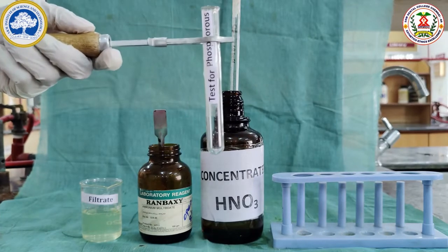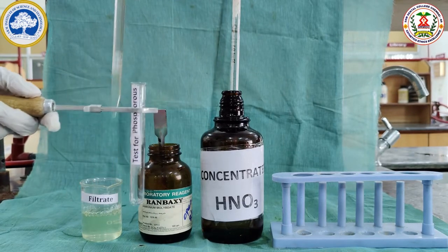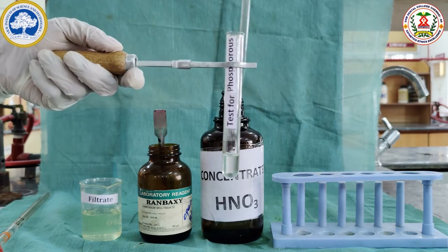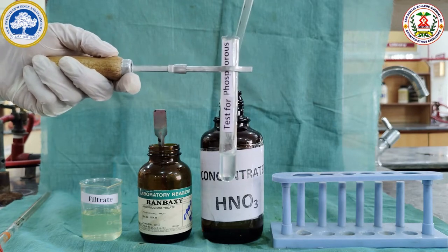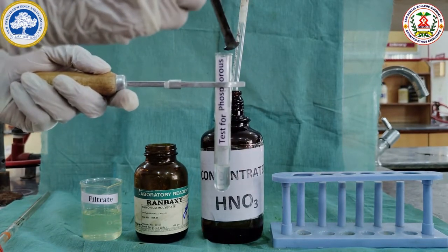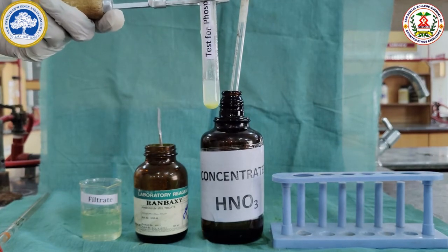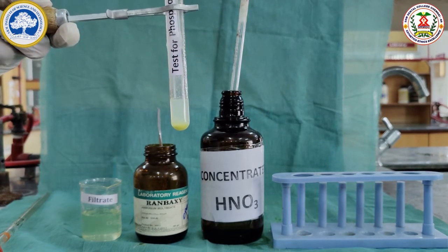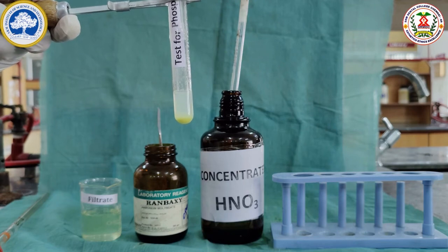The filtrate sample is rich in phosphorus. For this, we take 2 ml of the filtrate sample and acidify it with 5 drops of concentrated nitric acid, followed by the addition of a pinch of ammonium molybdate. Phosphorus reacts with ammonium molybdate and forms ammonium phosphomolybdate, which is canary yellow in colour. We can see the precipitation of phosphorus as ammonium phosphomolybdate, which is canary yellow in colour.